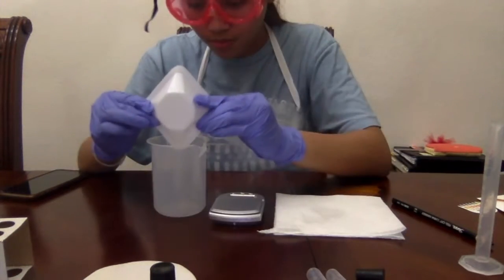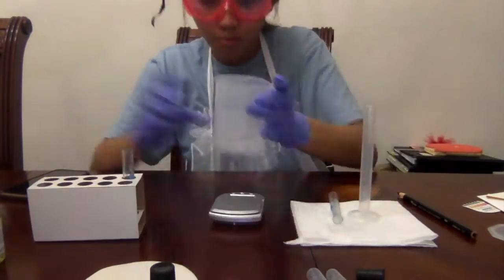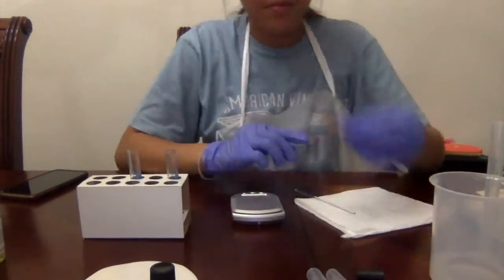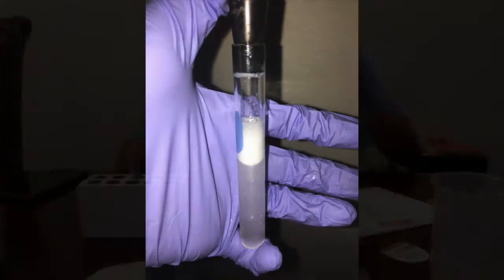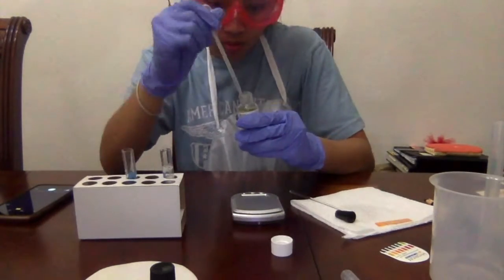The first test tube with the addition of vegetable oil again produced a thick, white foamy layer. However, the water solution was much more cloudy in comparison to either the homemade soap or first test tube. Lastly, test tube 2 with hard water produced a foamy layer, but one thinner than either test tube 1 or the homemade soaps. It also had a cloudy water layer underneath.